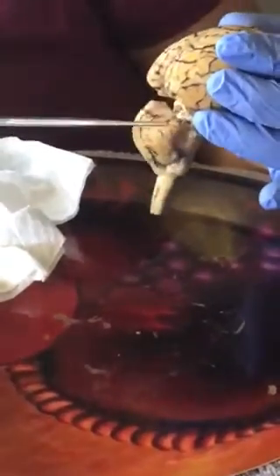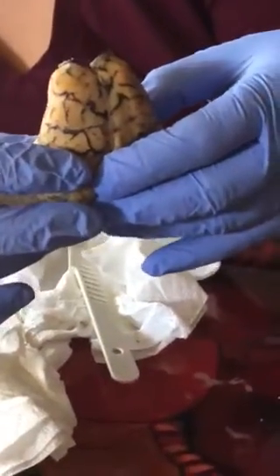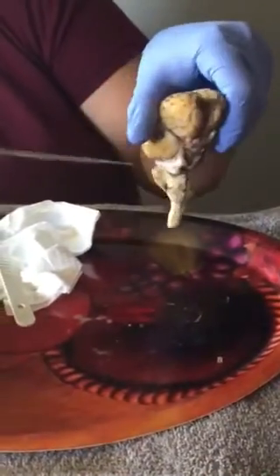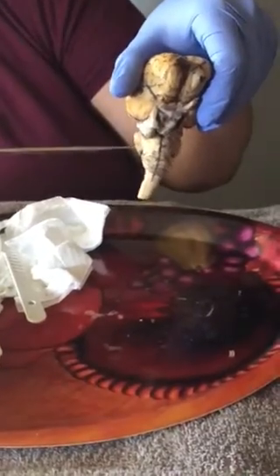After that, sorry, this is the cerebellum again. So cerebellum, pons, and medulla oblongata. I'm trying to see what best part would describe it. I could probably use it here and say that this is the cerebellum, pons, and medulla oblongata.